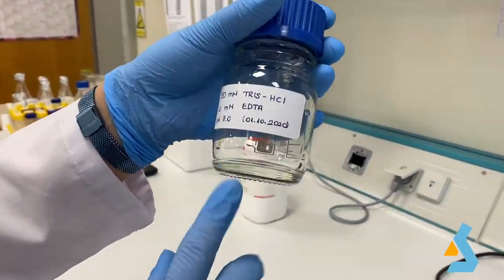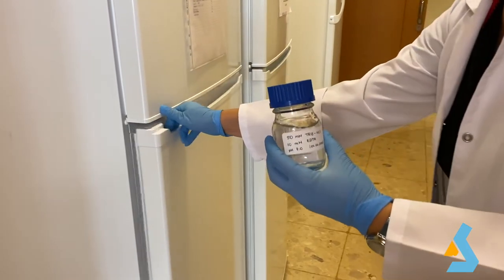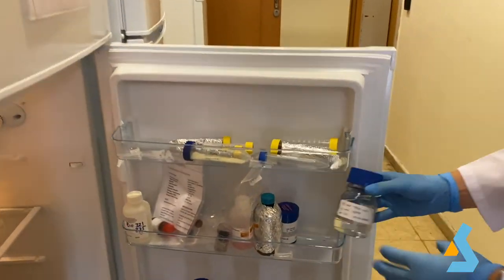Once your buffer is done, you should label it with all the details and then at the end, you can store it under recommended conditions until your next use.